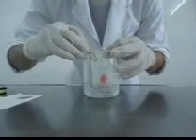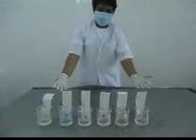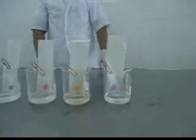Next, place each strip in a beaker and fasten it in place using a paper clip. Do this in a vertical position so that the bottom will be soaked first in the water. Here is our setup and we are ready to let the water rise up the filter paper and separate the individual colors. The dye coloring used in the sweets is a combination of two colors.